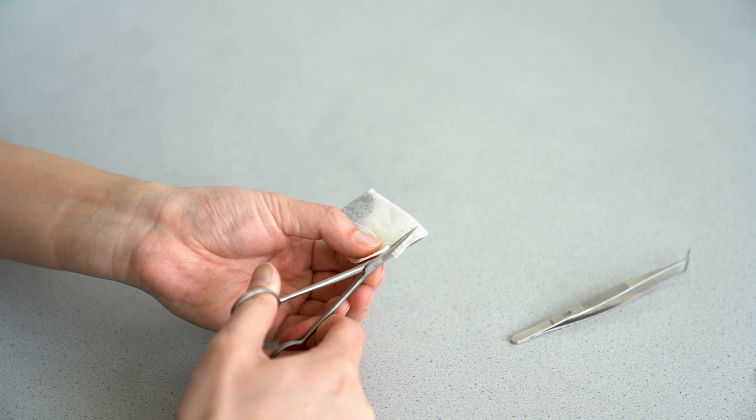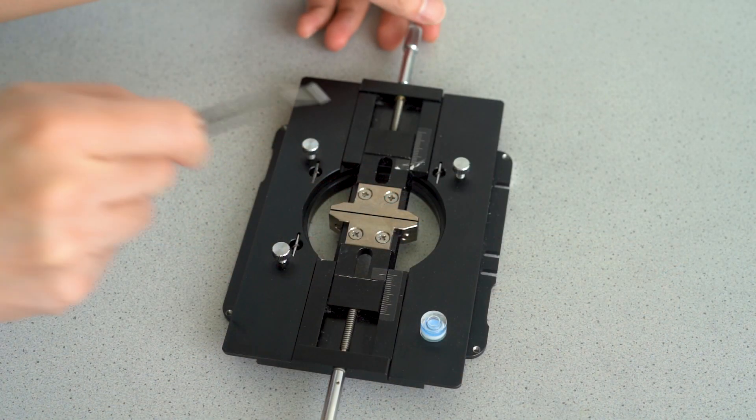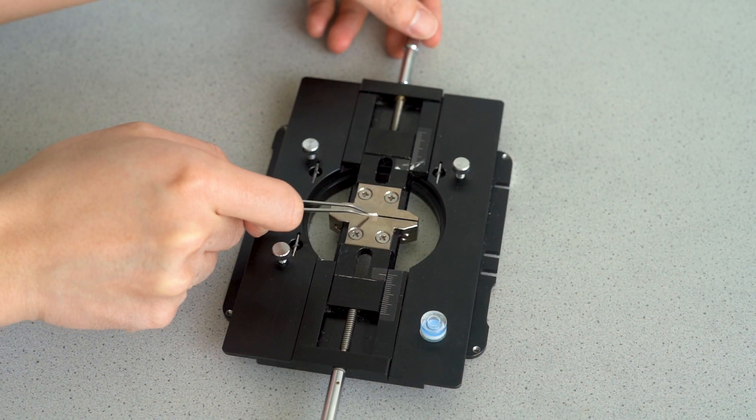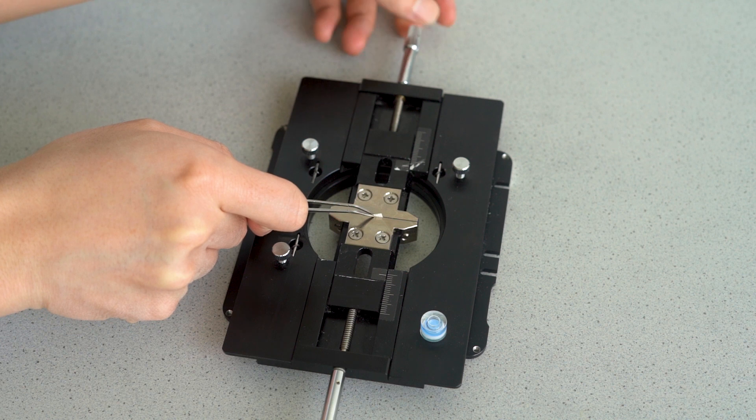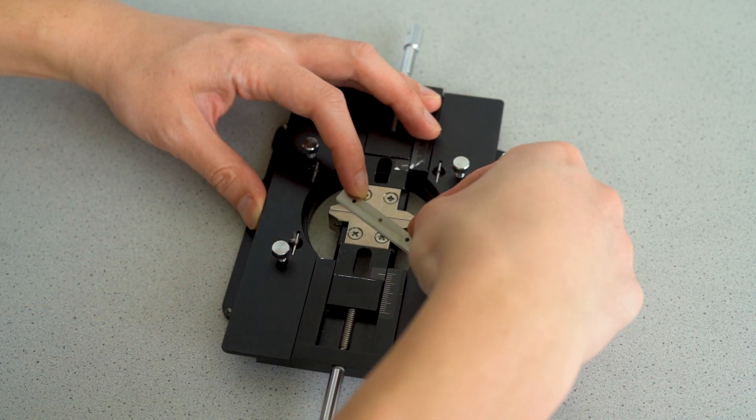To perform this analysis, we cut the tea bag to size, clamp it in the microvice holder, and cut the rest flush with the holder.